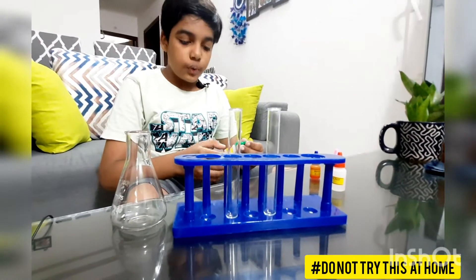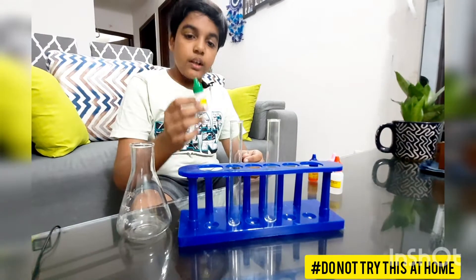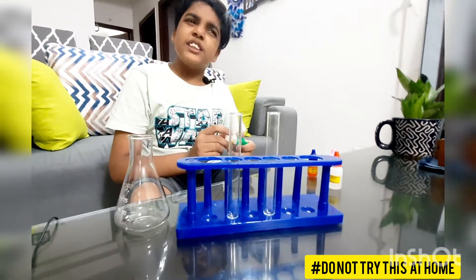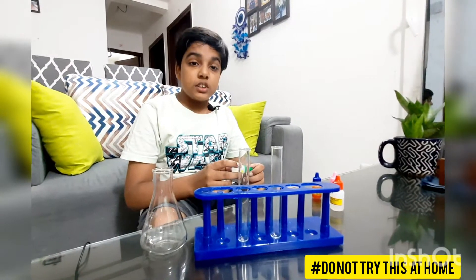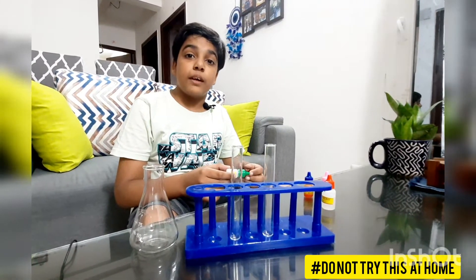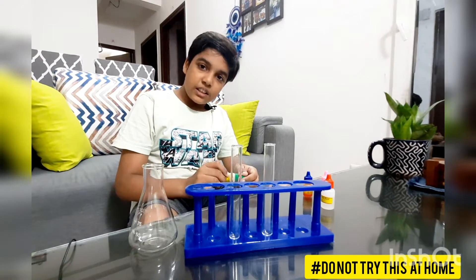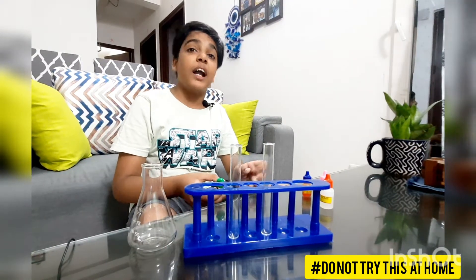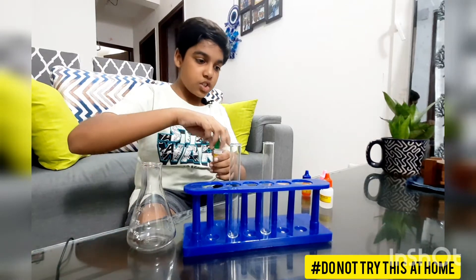First of all we'll check it with the phenolphthalein indicator. But what is an indicator? An indicator is a substance which determines whether the chemical or substance we are using is either acidic or basic in nature, by showing different color changes. Let's see what the color change is.